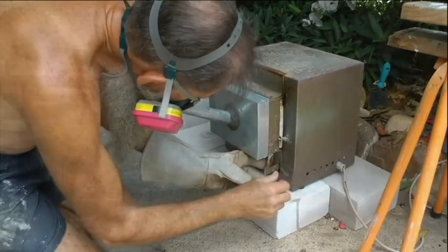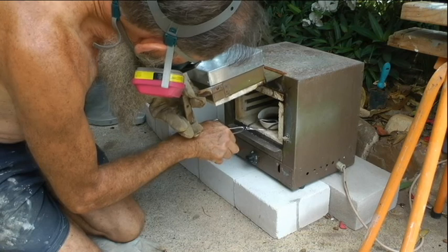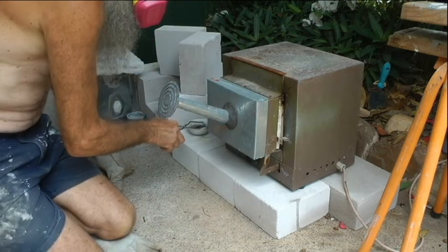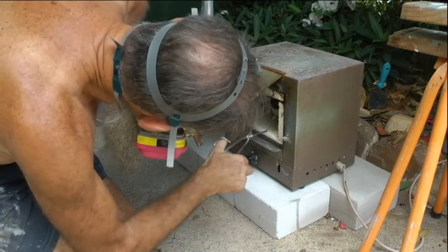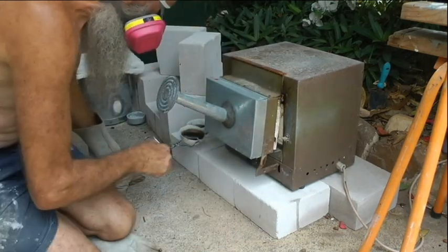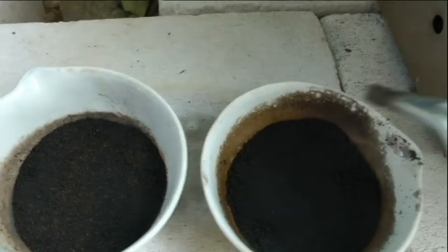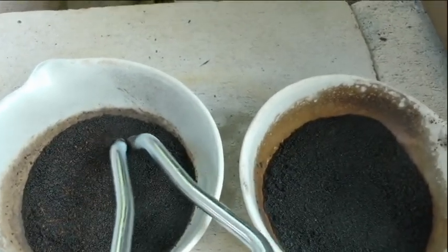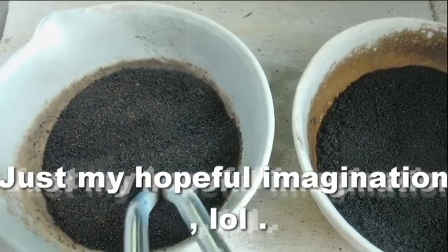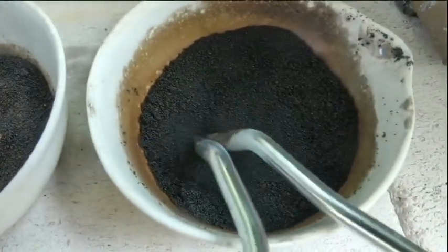Alright. Now that looks a bit more like it. That looks better. This one here, it actually looks like I can see gold or copper in it. The colour of it, even little pieces in it. I don't know. But this one just appears to be all black.